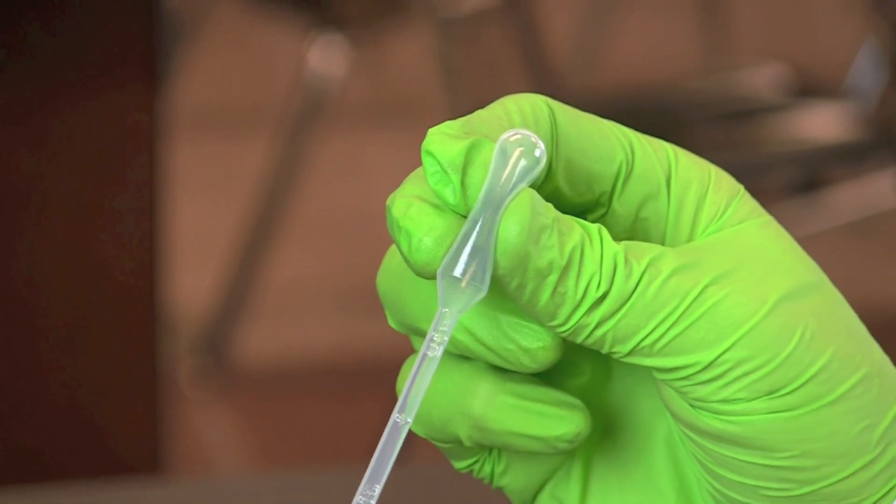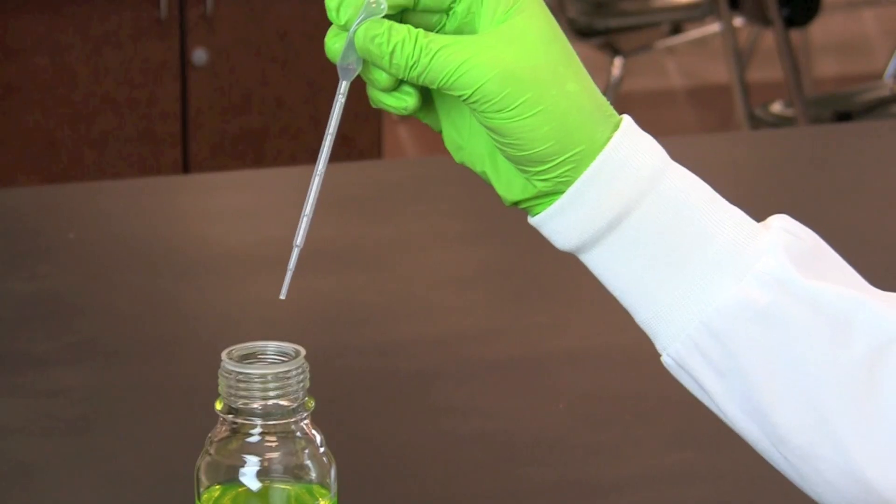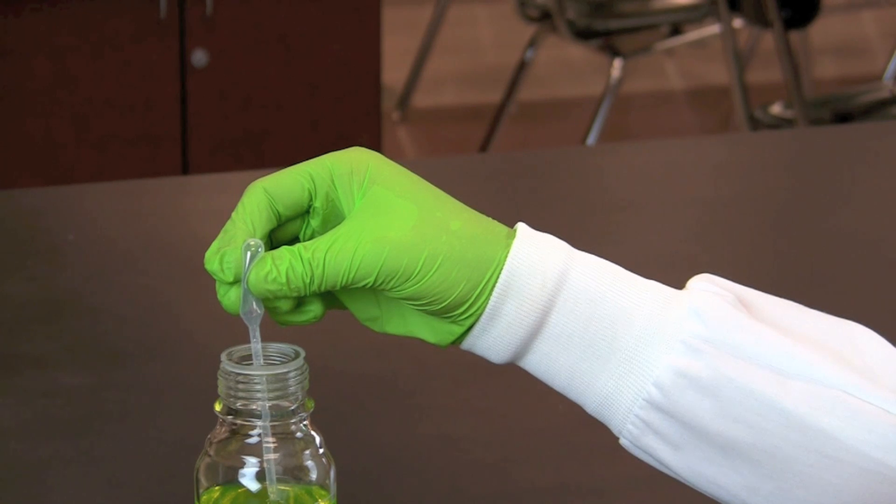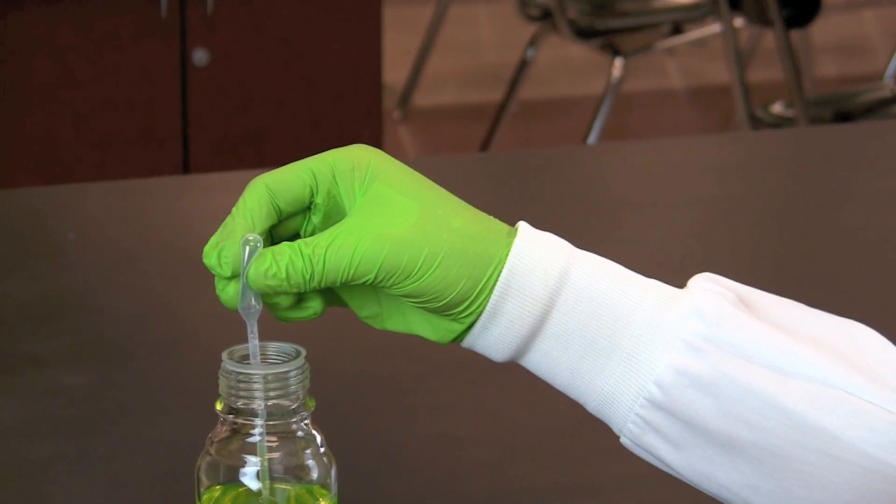To transfer a solution, start by gently squeezing the bulb and placing the tip into the solution. Then slowly release the pressure until the solution partially fills the bulb.